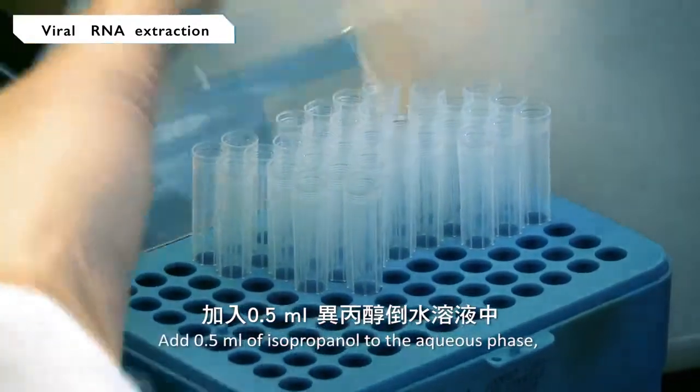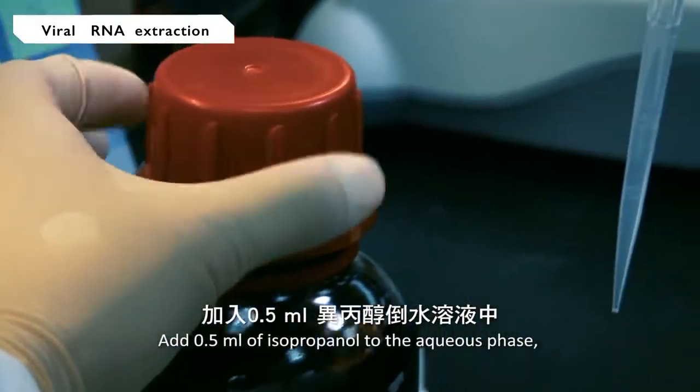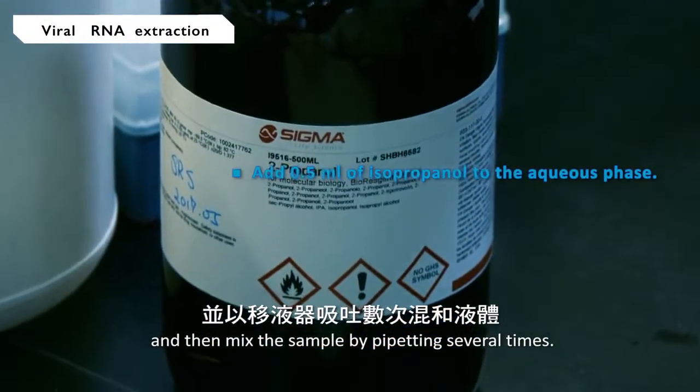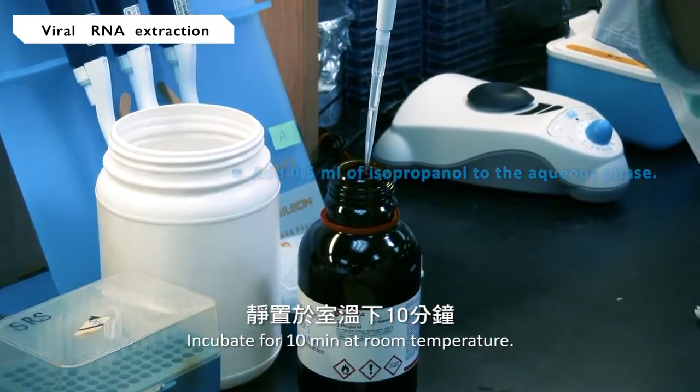Add 0.5 milliliter of isopropanol to the aqueous phase, and then mix the sample by pipetting several times. Incubate for 10 minutes at room temperature.